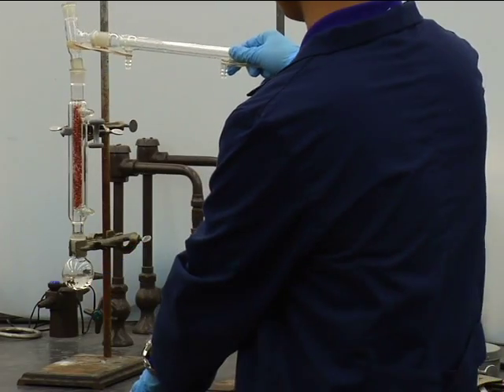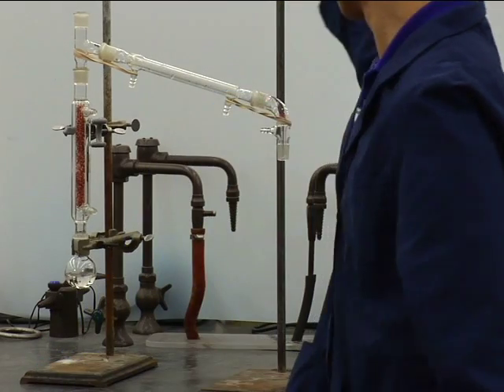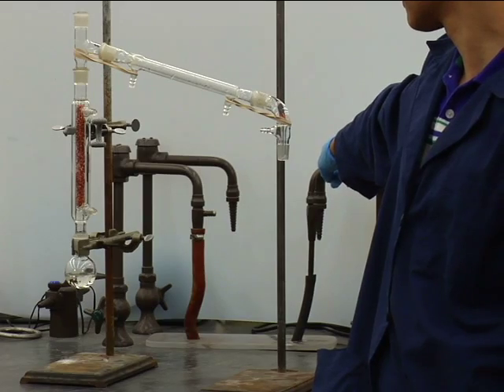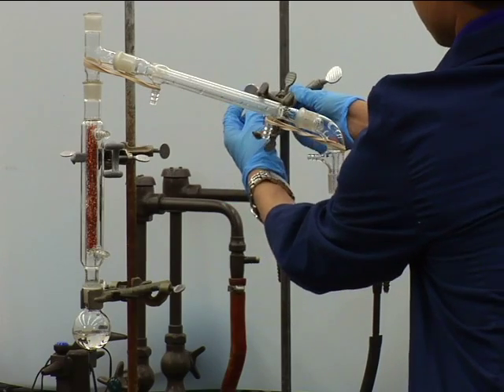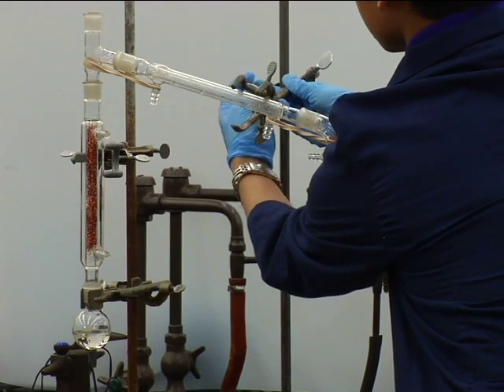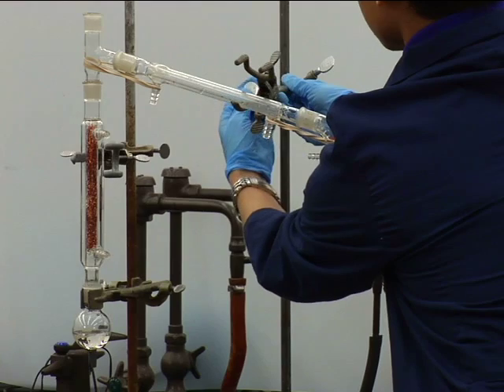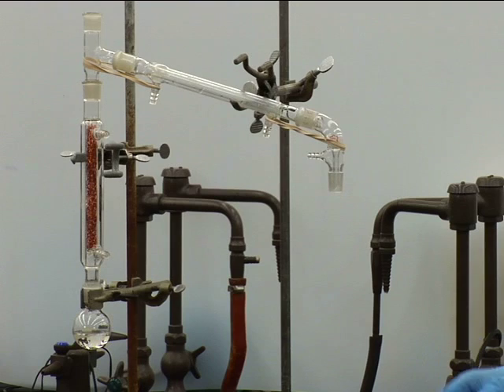Mount the pre-assembled pieces on the distilling column, then position the still on the desktop so that it is near enough to a cup sink for the condenser hoses to reach. Then use a ring stand and clamp the condenser loosely with a large three-finger clamp in such a way that the clamp gently supports the condenser from underneath and prevents the still from tilting. Again, if you clamp this condenser tightly, it may force a misalignment of the standard taper joints and cause a vapor leak or broken glassware.